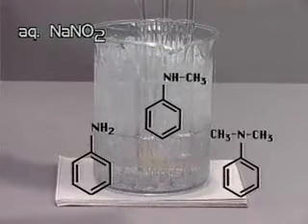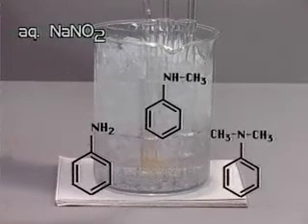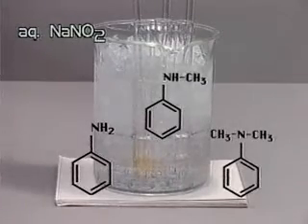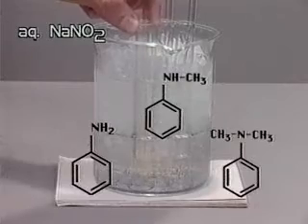Each amine is dissolved in 6 molar hydrochloric acid and cooled in an ice bath. A solution of 25% aqueous sodium nitrite is added to each tube.